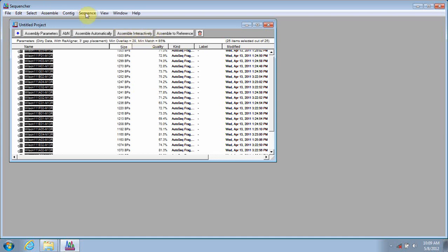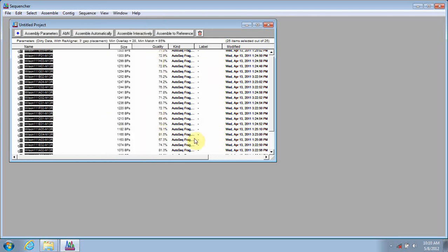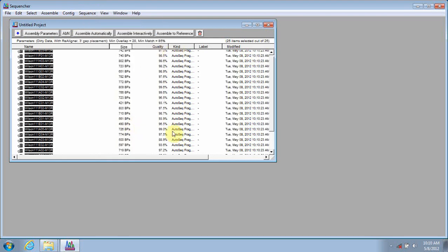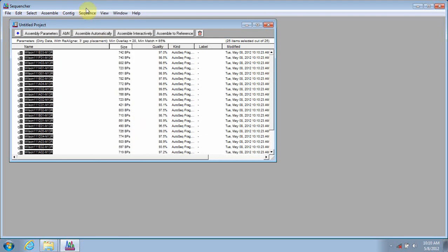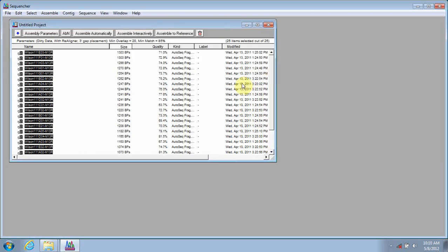Under the sequence menu, you have multiple options here. You can always trim your ends without preview. We do have a set of default trim parameters that are in place, and for a wide range of purposes, it does work great. You'll notice here that we have an average quality score of about 70 to 75%. If I do trim ends without preview, immediately we notice I have an increase in quality of about 20%. Again, you never have to worry about losing your experimental data within the program. If all the sequences are highlighted, I simply have to hit revert to experimental data. Back to my original data set.